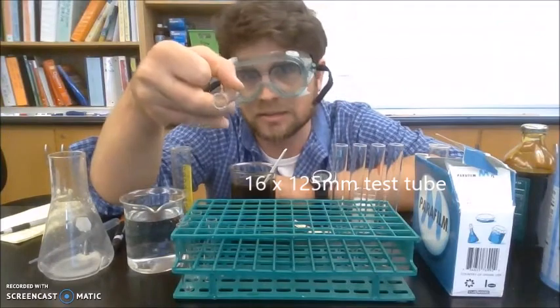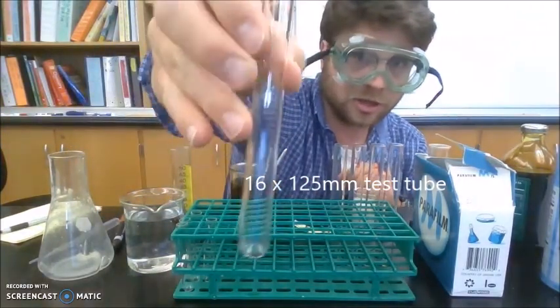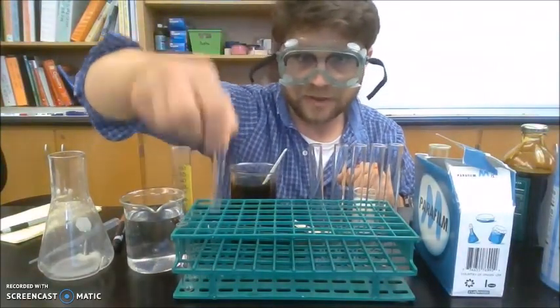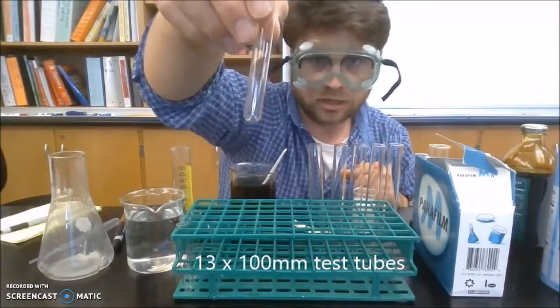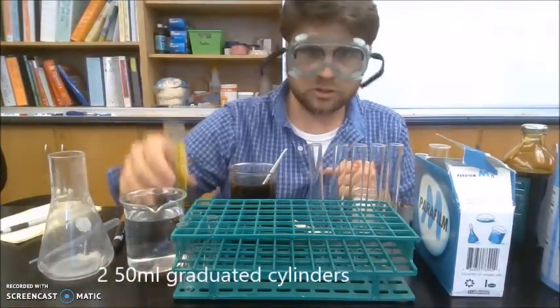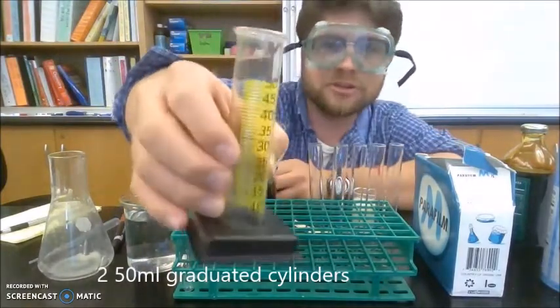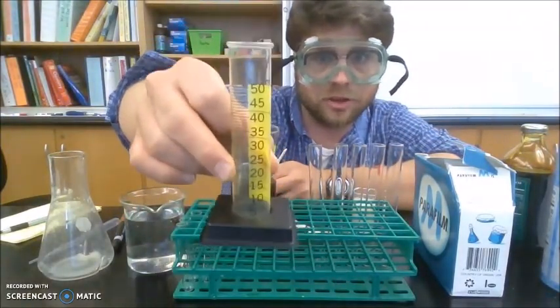Now the 16 means it's 16 millimeters in diameter, 125 millimeters high. And then I have 5 13 by 100 millimeter test tubes. I have 2 graduated cylinders. They're graduated because they have all those lines that help us measure volume.